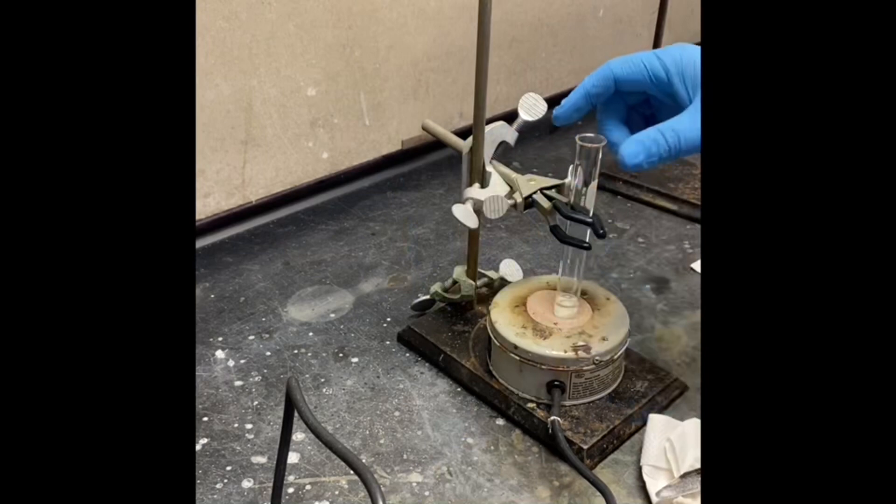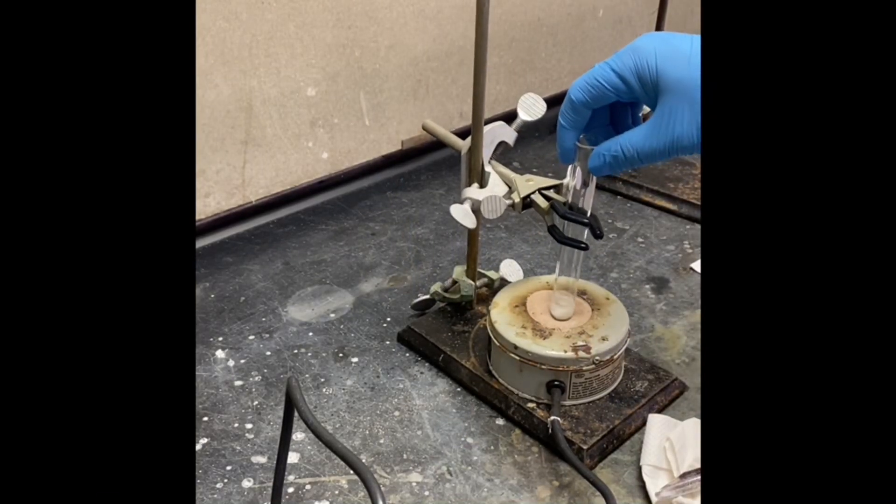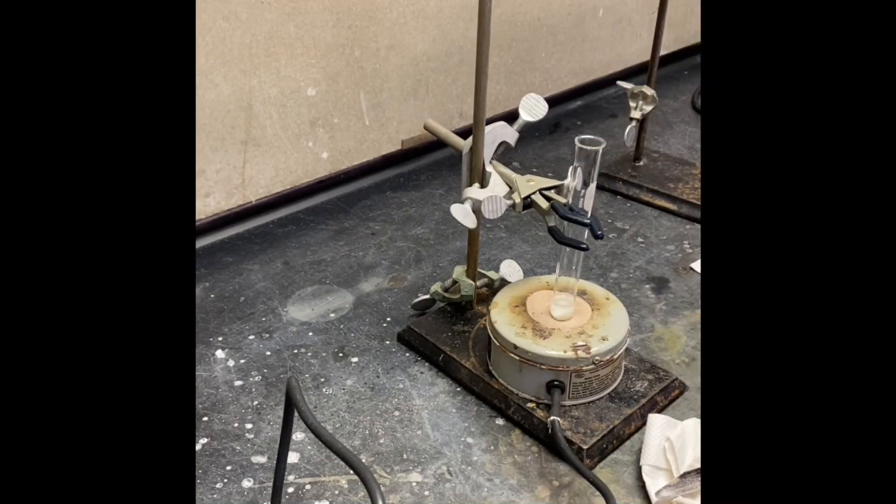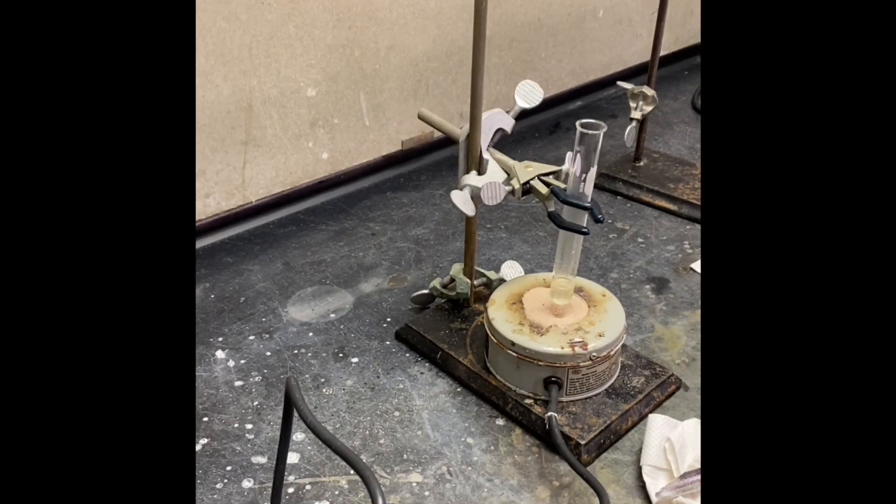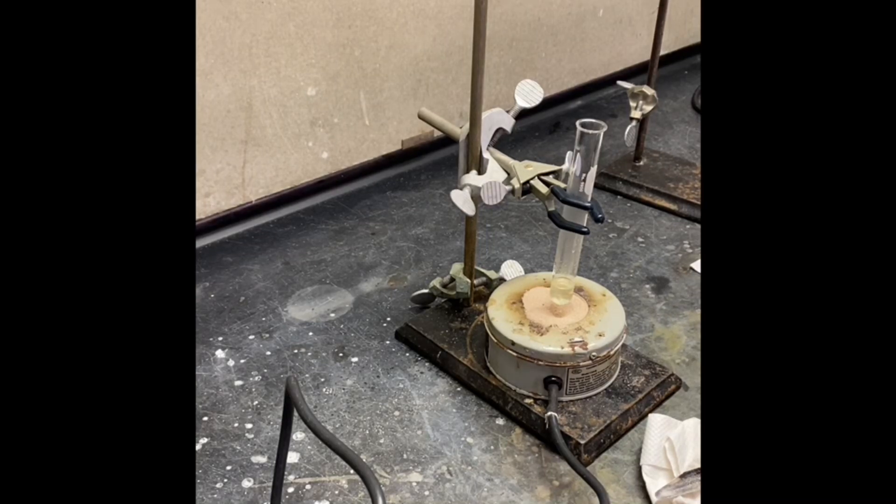Now I'm going to add three mL of triethylene glycol, which is going to be the solvent in this reaction.